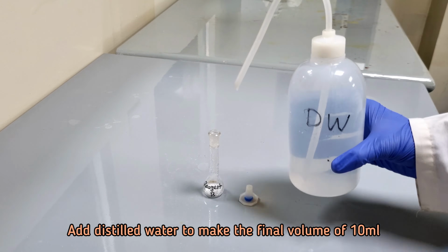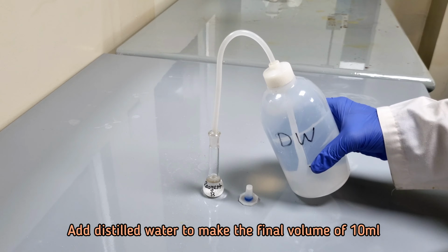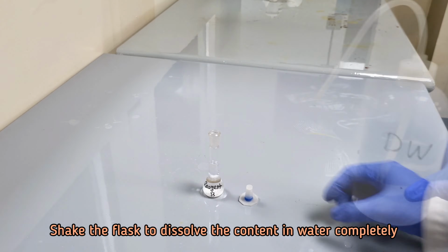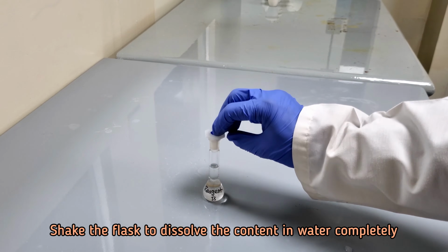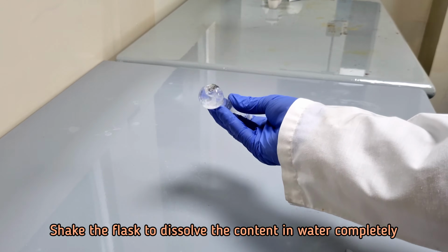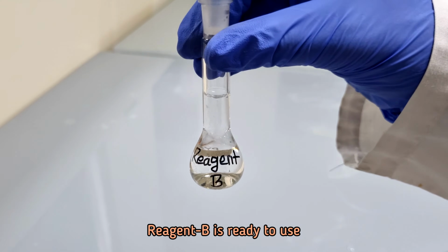Add distilled water to make the final volume of 10 ml. Shake the flask to dissolve the content in water. Reagent B is ready to use.